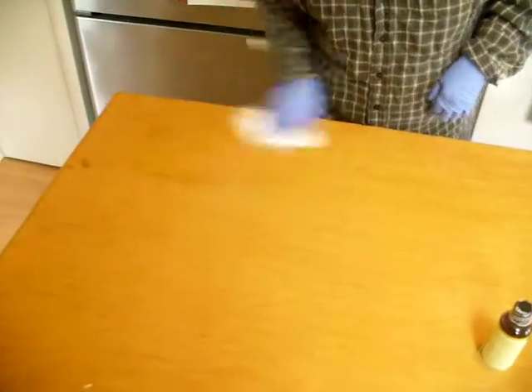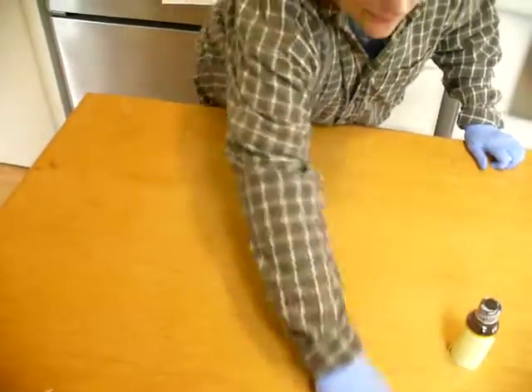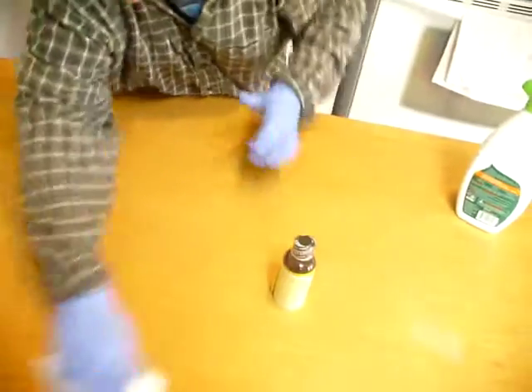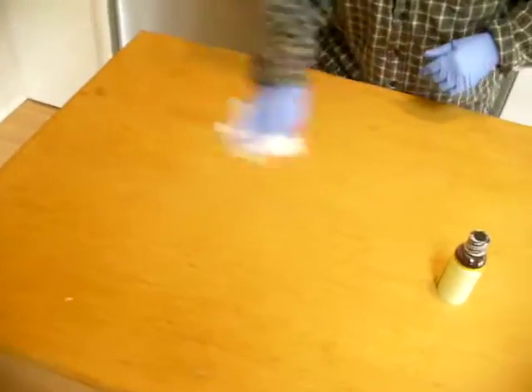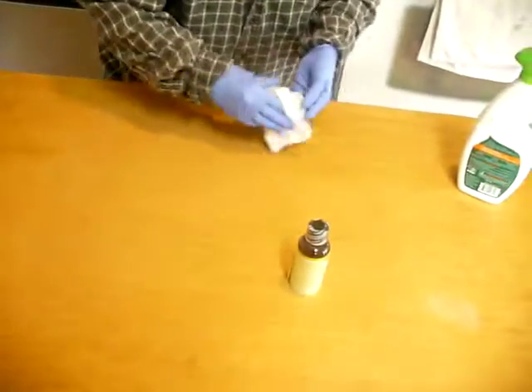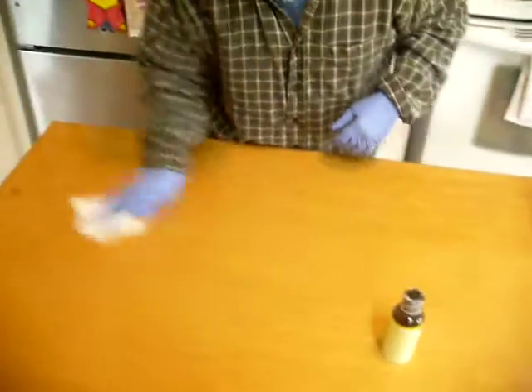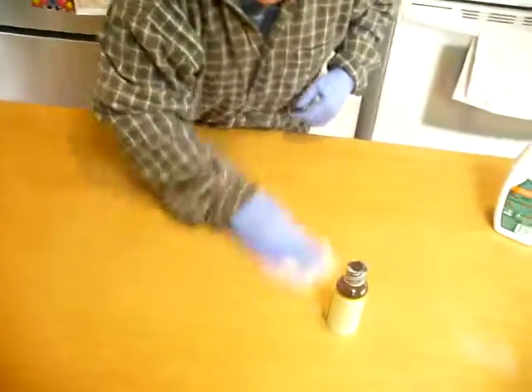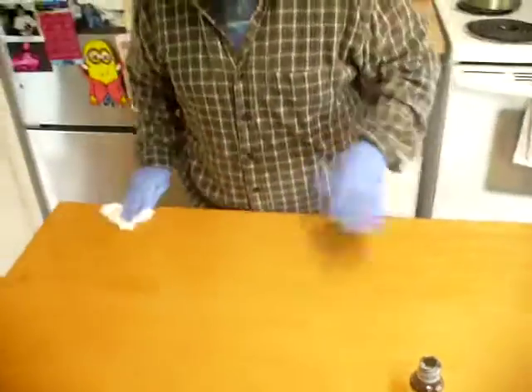Finally, I will spray off my work area, spray it again, and wipe it off so that hopefully I have removed any bacteria or any other materials that I might have gotten on the surface of my workspace.